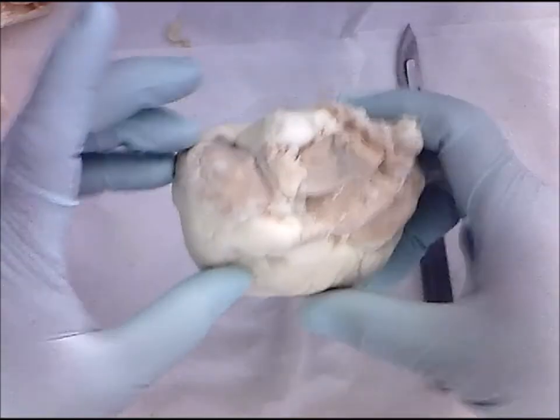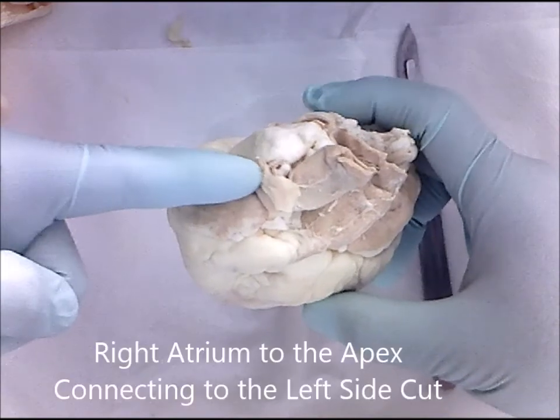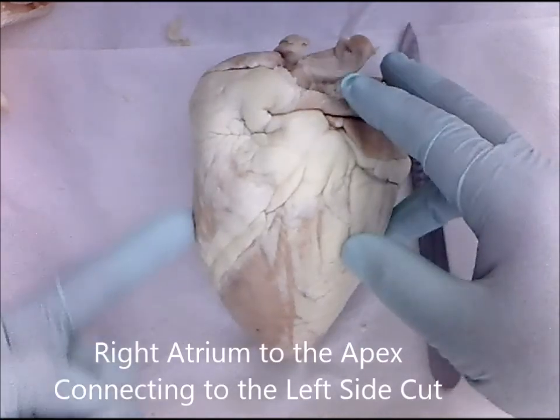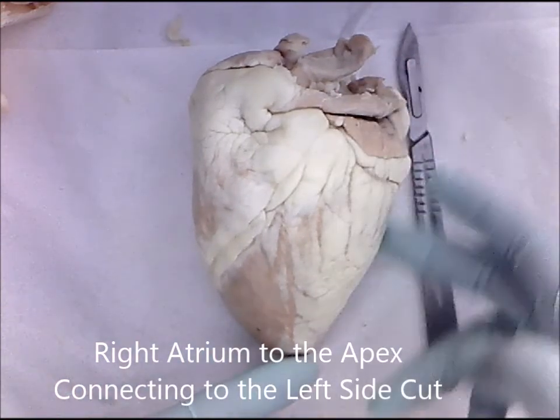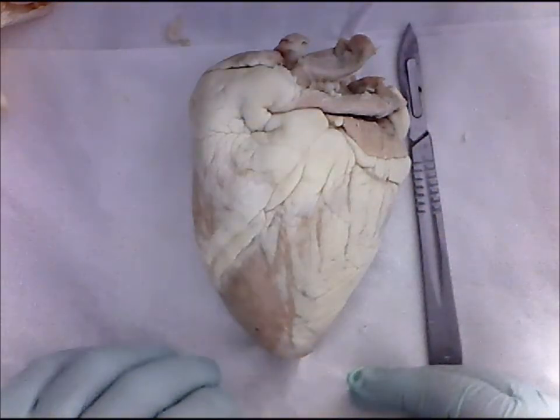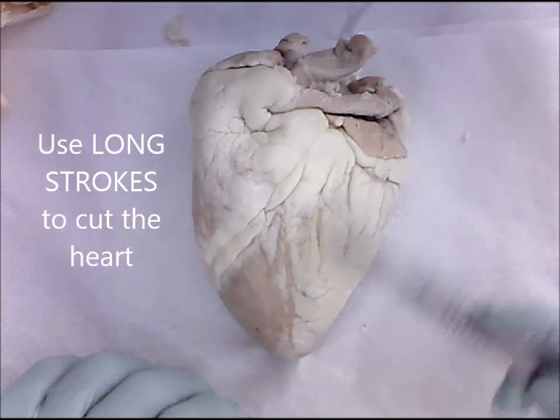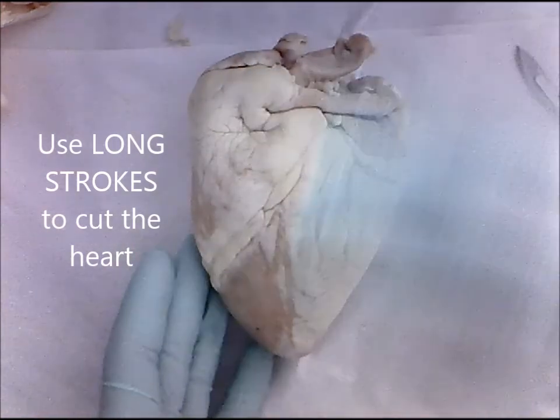You are then going to make an incision through the middle of the right atrium, along the right side of the heart, down to the apex, meeting with your left side cut. From here, you may have to pry open the heart and carefully use your scalpel to cut away tissue so that you create two equal halves.